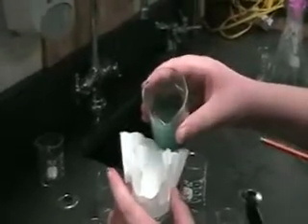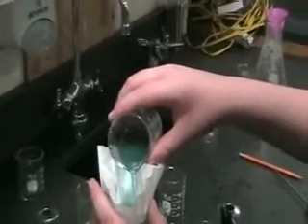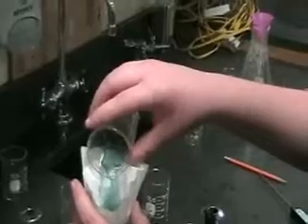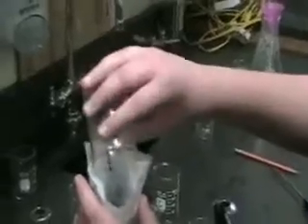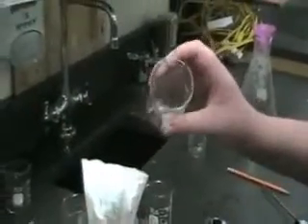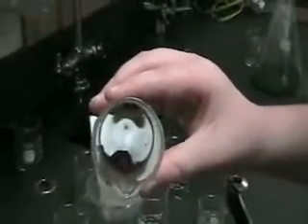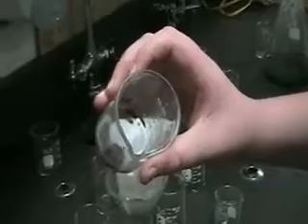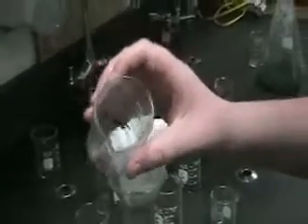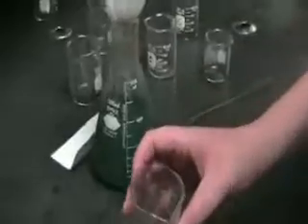The appearance of copper chloride — go ahead. You can take a look at it in the beaker there. Let's see what that looks like — tip it down a little bit. So what color would you say that is? I'd say reddish, kind of brown — reddish brown. I'd say mine's purple. And the color of the liquid was kind of that bluish green. I'd say kind of a bright blue. They're hot.